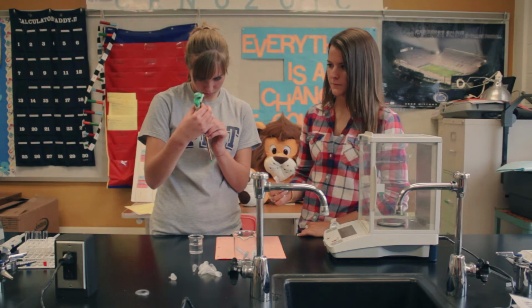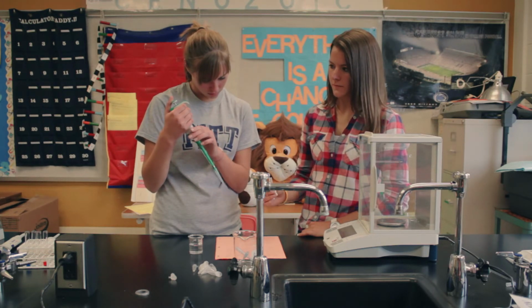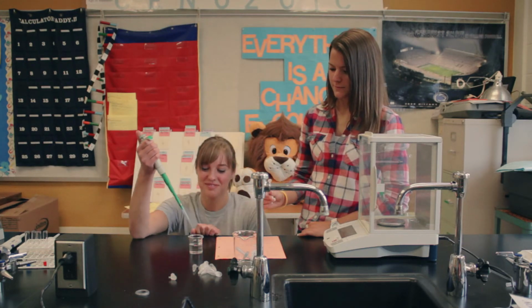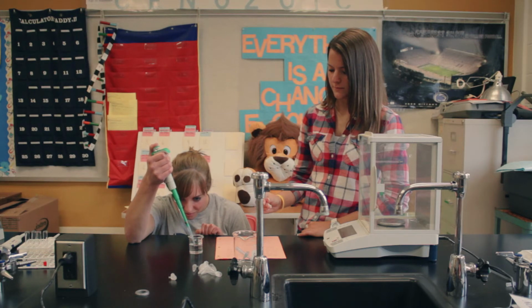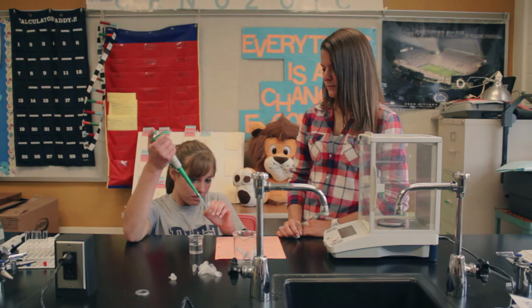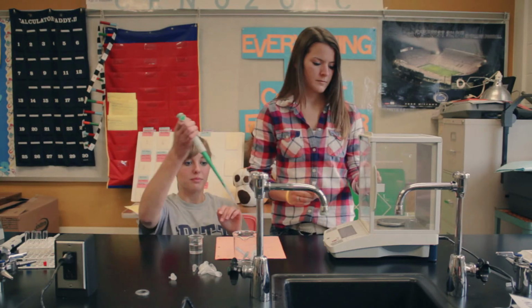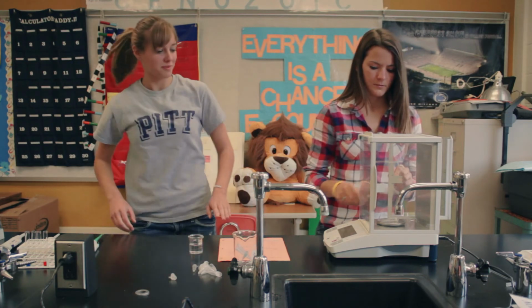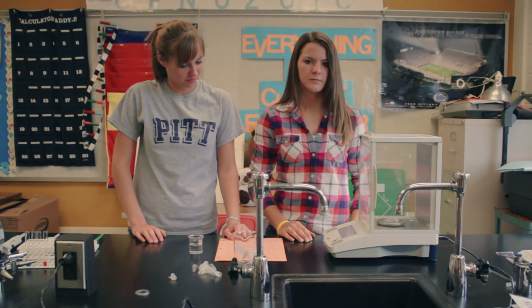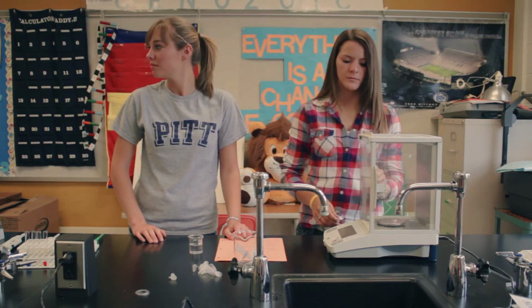And then once you obtain this data, you can do whatever necessary calculations you have to do, that Ms. Anselmina will give you. So fill the tube. Put it in. And again, that's going to give you the mass of the water that's inside the tube. And you can use that to determine how accurate you were with the micropipette.